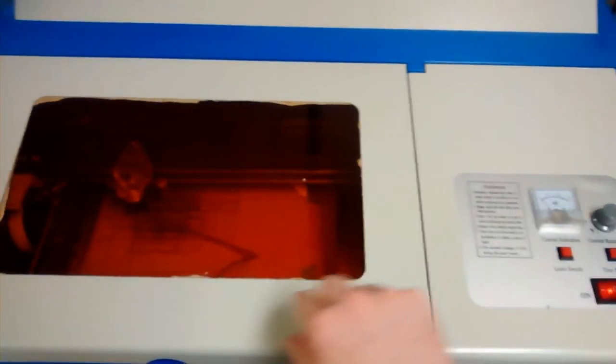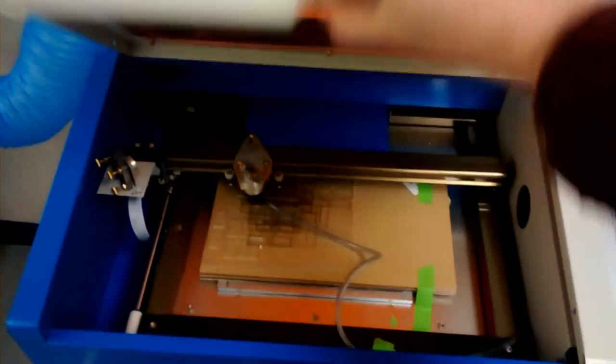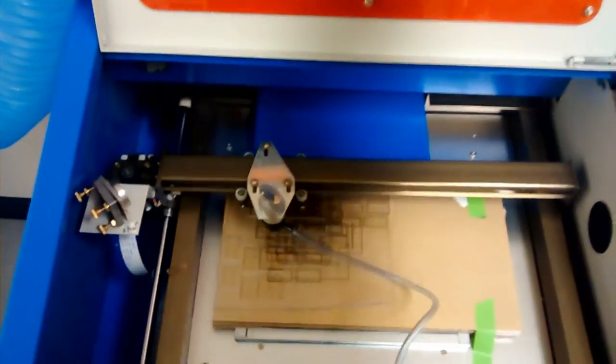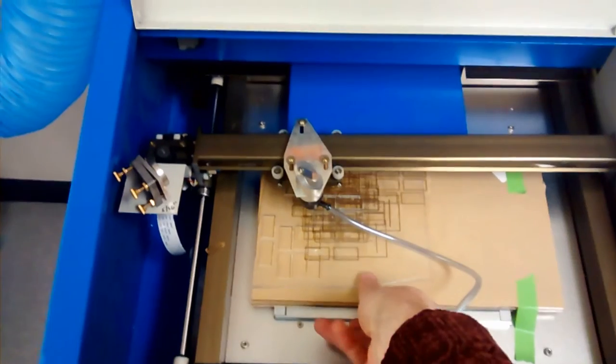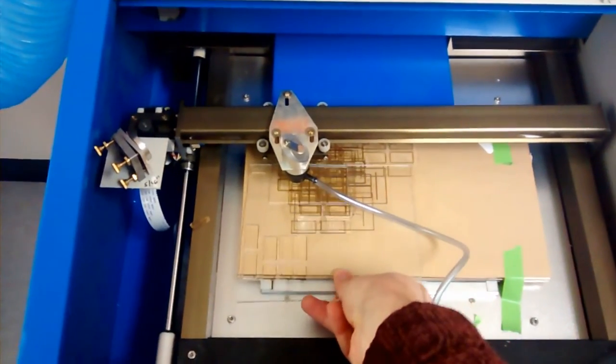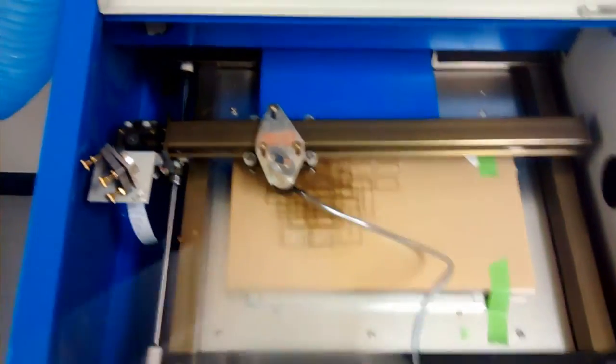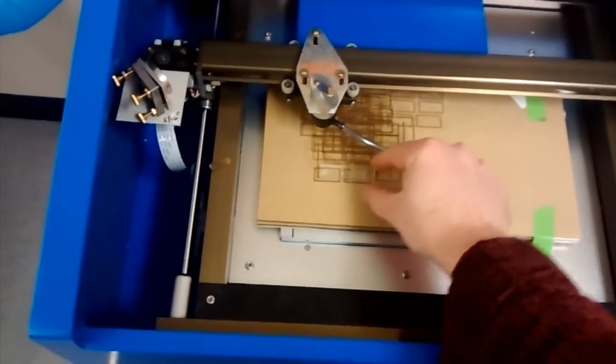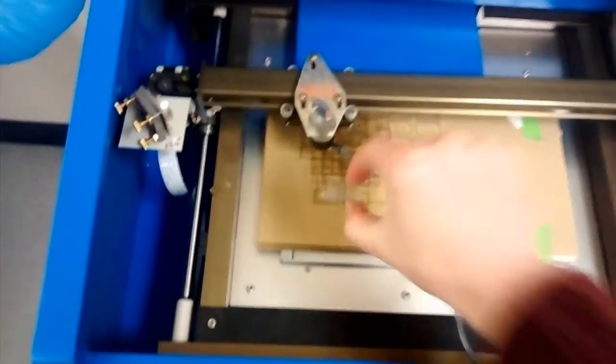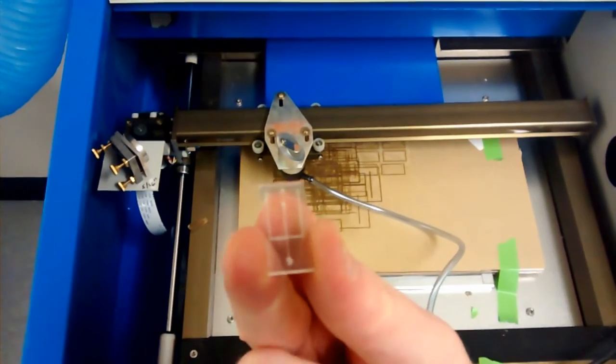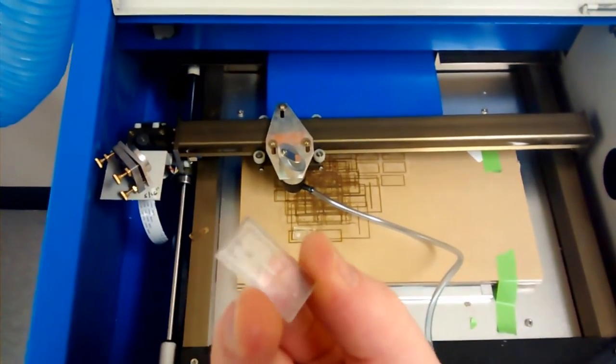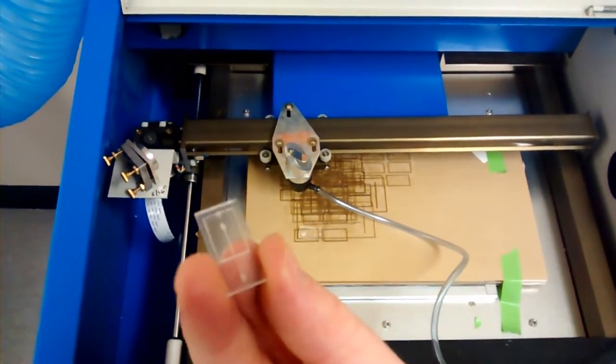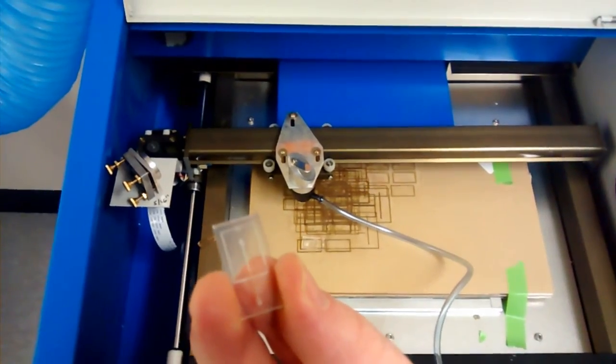Okay disarm the laser and when you're done cutting all of your lines and through cuts you can pull out the substrate. If you've cut around your pieces you can just pull one out. You can see there are lines cut into the surface and through holes cut all the way through the acrylic.